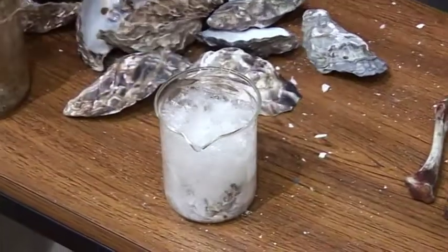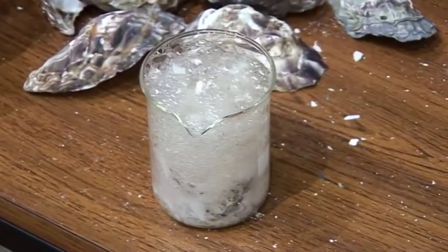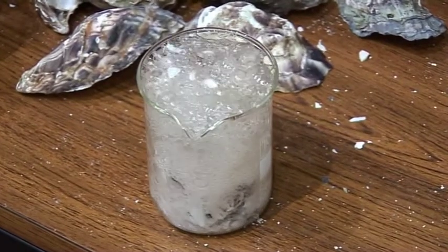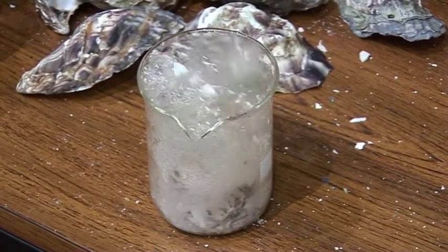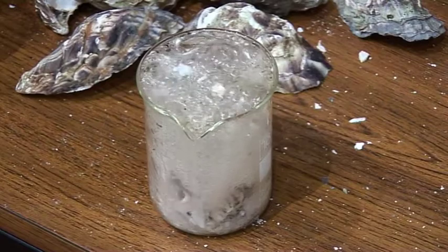Again, we get the same fizzing that we saw here — bubbles of carbon dioxide given off from the shells containing their calcium carbonate.